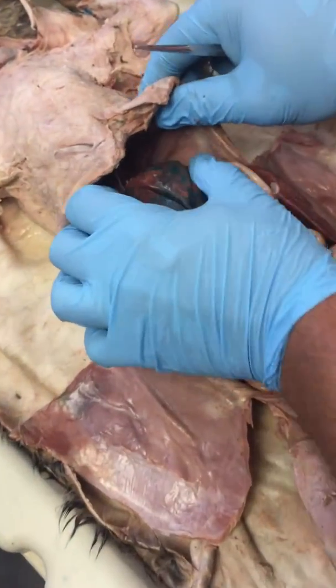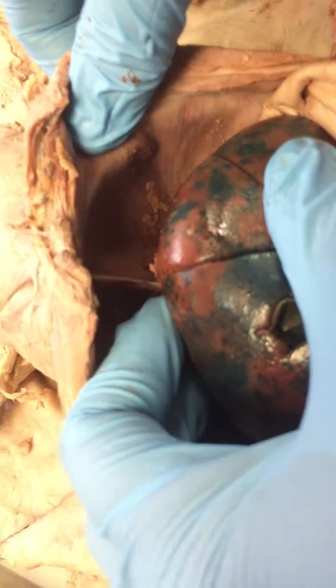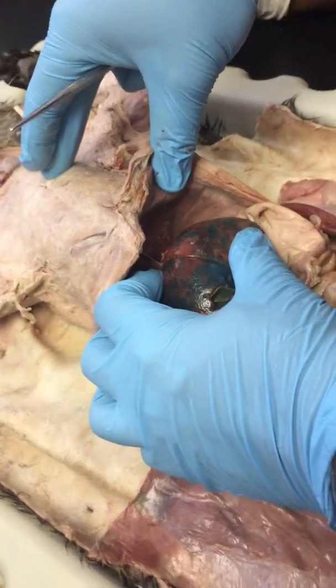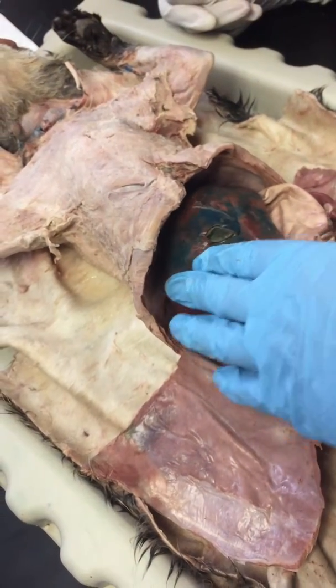And the last muscle that you're responsible for, if you pull down the liver a little bit, you can see that dome-shaped muscle in there that really separates the abdominal pelvic cavity from the thoracic cavity up here. That's called the diaphragm. That's a big one. And that's sitting right on top of the liver.